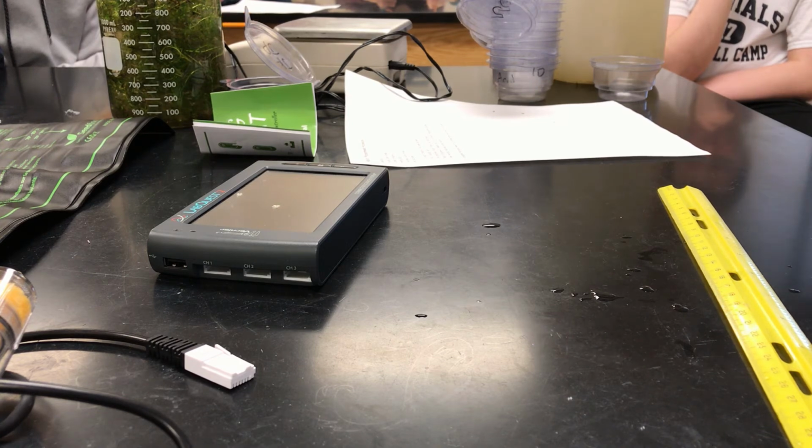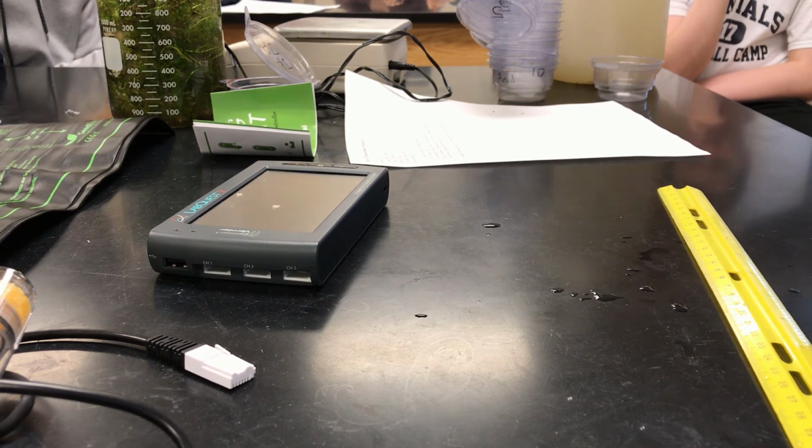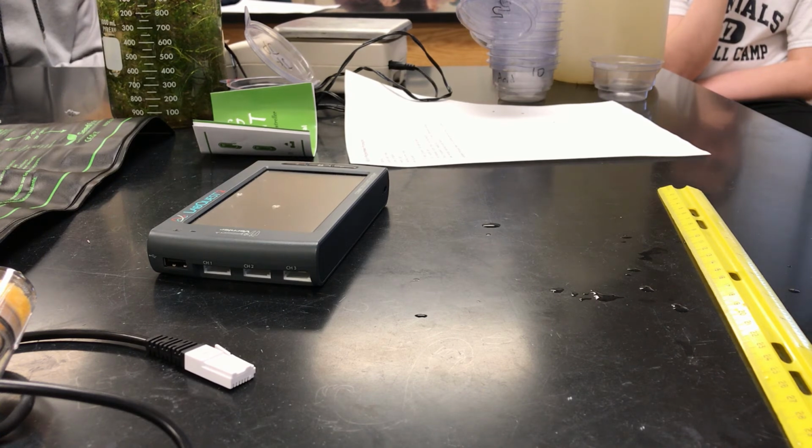So I will definitely have a couple of containers of aged tap water sitting over on the counter that will have naturally dechlorinated by light. So they're equivalent. And again, I'll have 2 of these. If for whatever reason you drain this because you set up next week or whatever, just fill the thing back up with tap water, put it back on the counter where you find it, and that way it'll be ready the next day for whoever comes along.